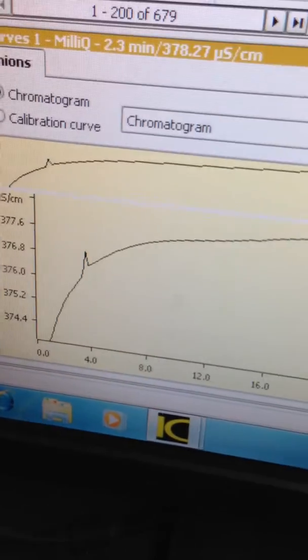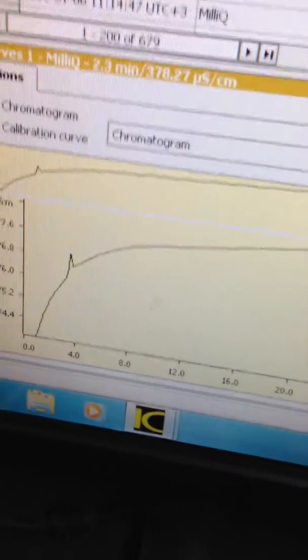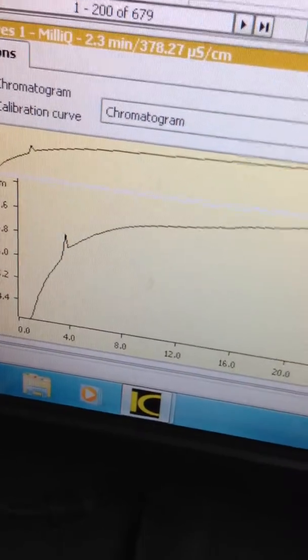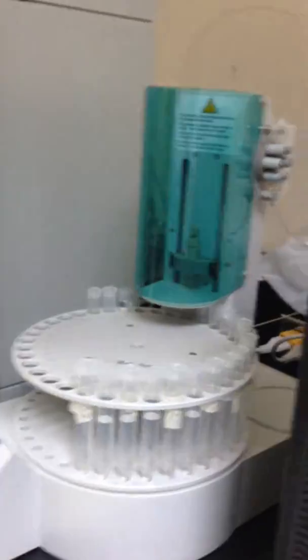So I didn't know what the problem was. I changed the water. I did those maintenance which I've mentioned, like changing the inline filter, the tubings, the guard column, the separation column, all of those maintenance. It took me quite a while, although I did not have extensive experience with the IC, but it took me about 3 weeks to get this solved.